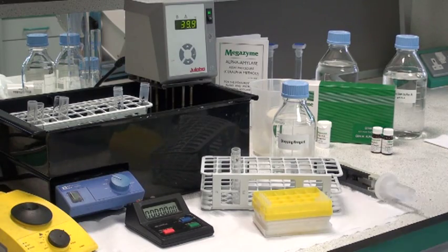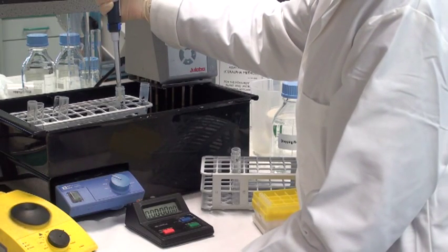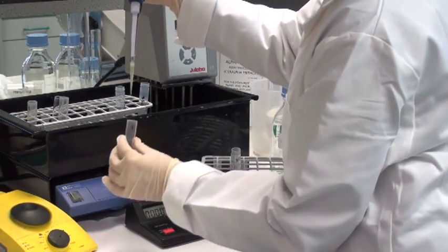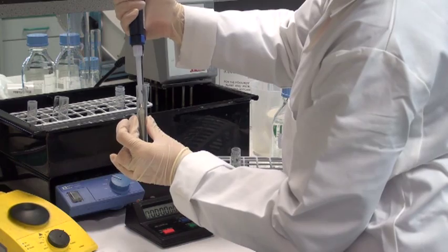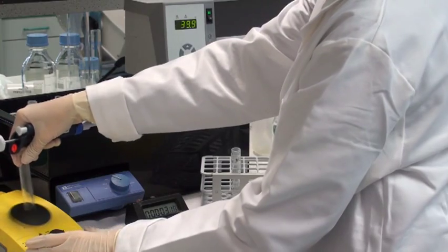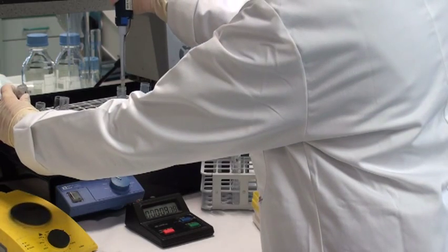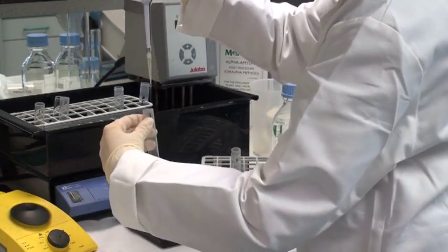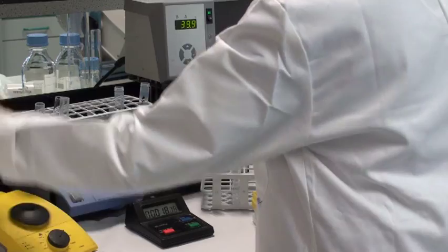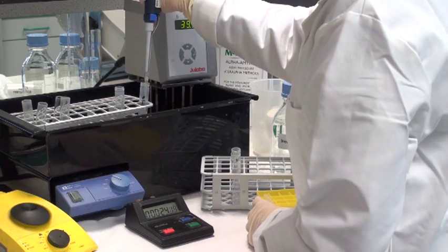To initiate the enzyme activity determination, transfer 0.2ml of the sample extract to the pre-equilibrated substrate. Be careful to transfer the enzyme to the bottom of the test tube to ensure that all of the enzyme comes in contact with the substrate. At the same time start the stop clock and after 15 seconds add the duplicate amount of enzyme to the substrate, again to the bottom of the tube, stir the tube and place back in the water bath. Change the tip on the dispenser and then take a sample of the second enzyme preparation and add this to the substrate.